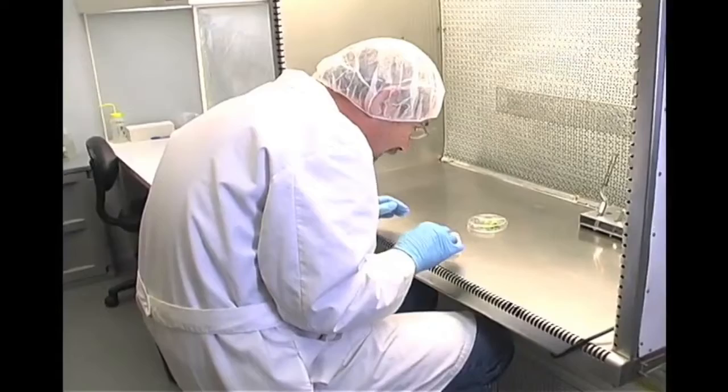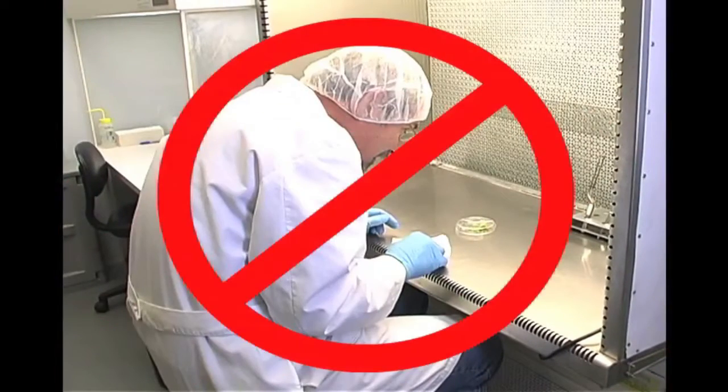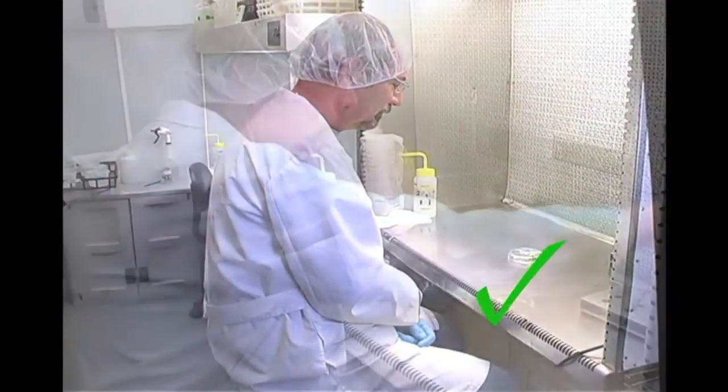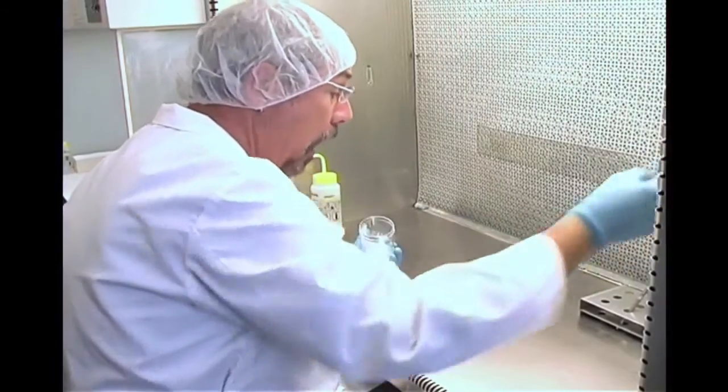Do not lean over the work area. Keep your back against the backrest of your chair. Try to work with your arms straight. This position may feel awkward, but it will reduce contamination. Talking or sneezing while culture material is exposed can also lead to contamination.